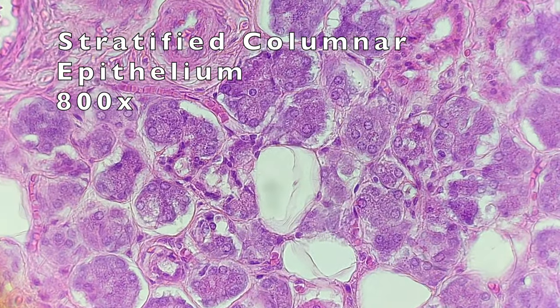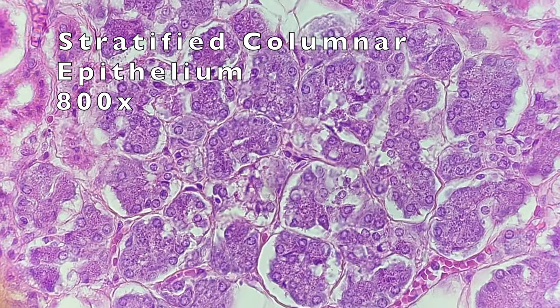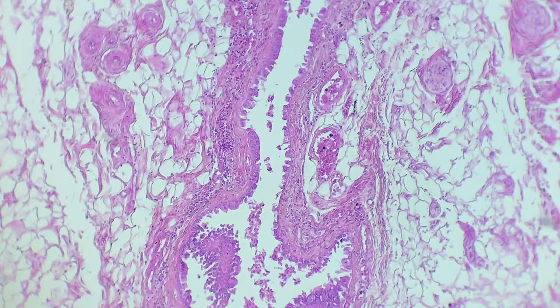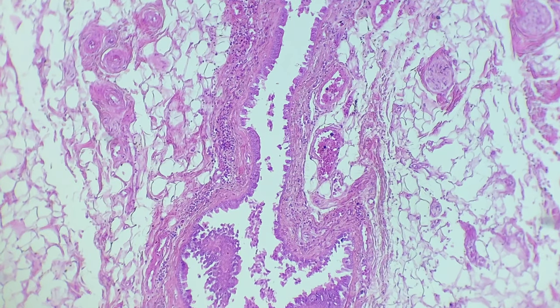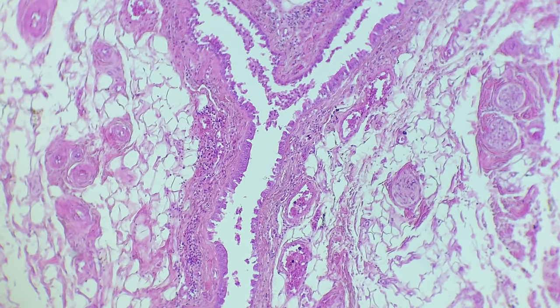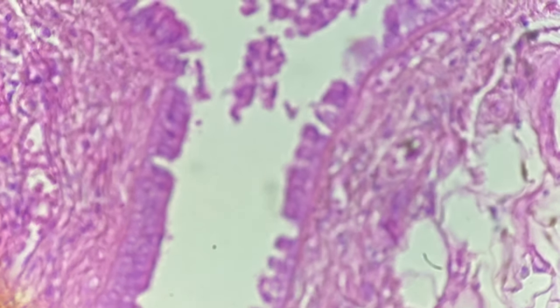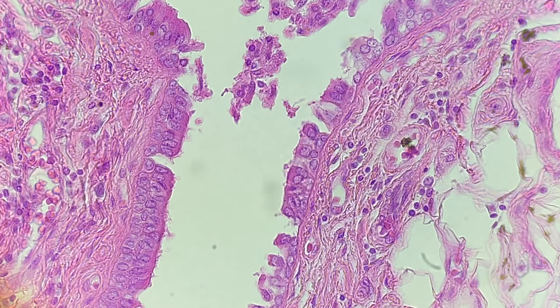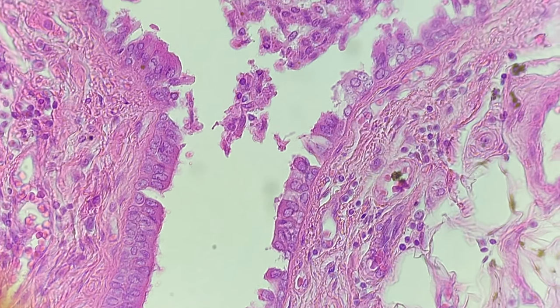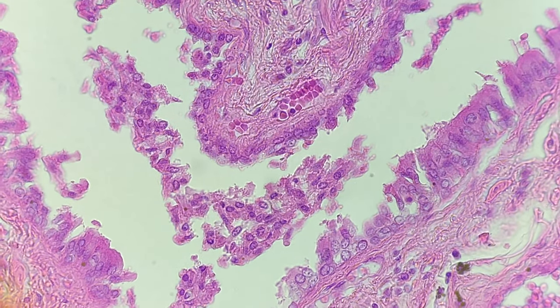After some more digging and searching around, I think this is where the actual columnar tissue is located. Zooming in here, this was the closest thing I could find to that columnar tissue.